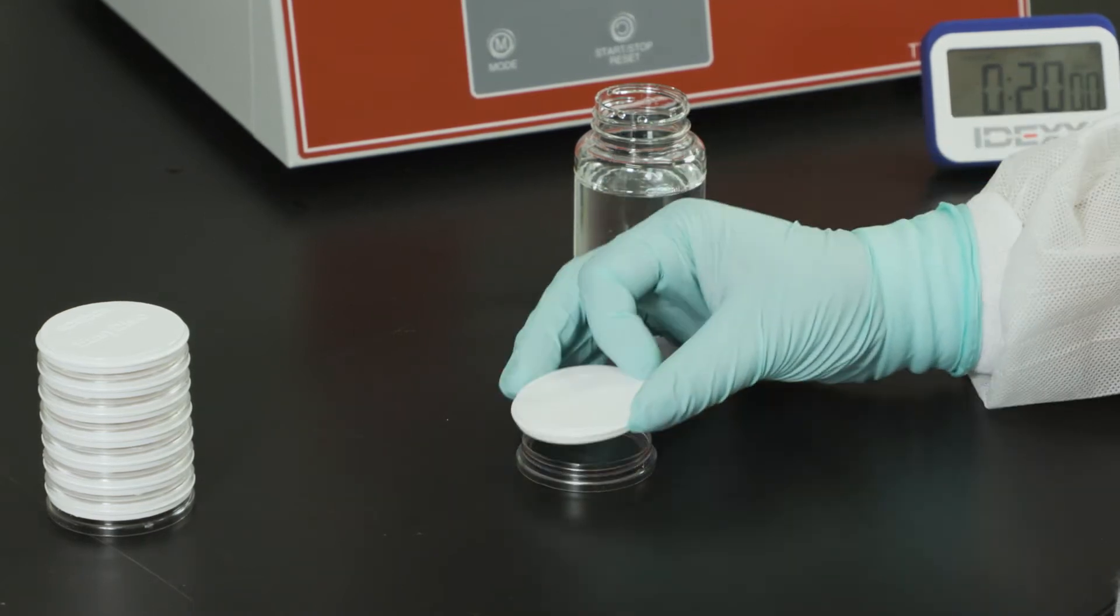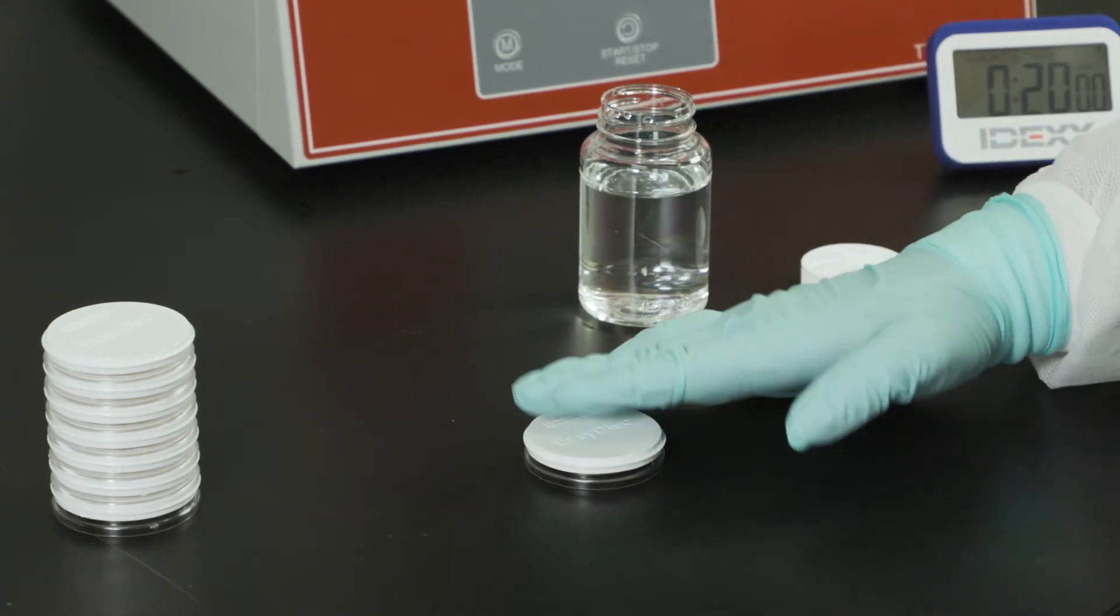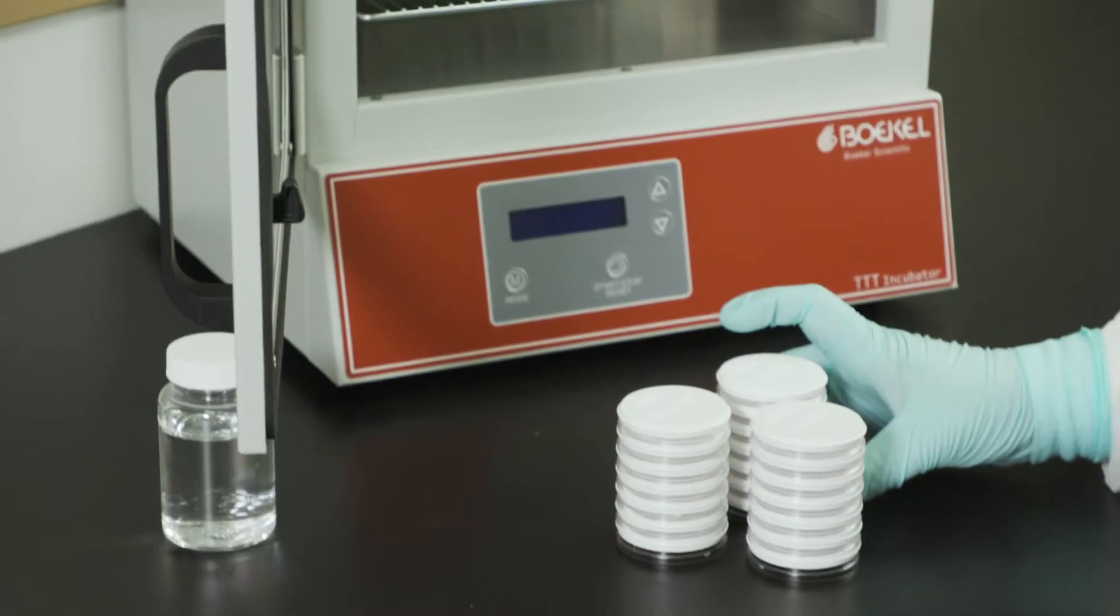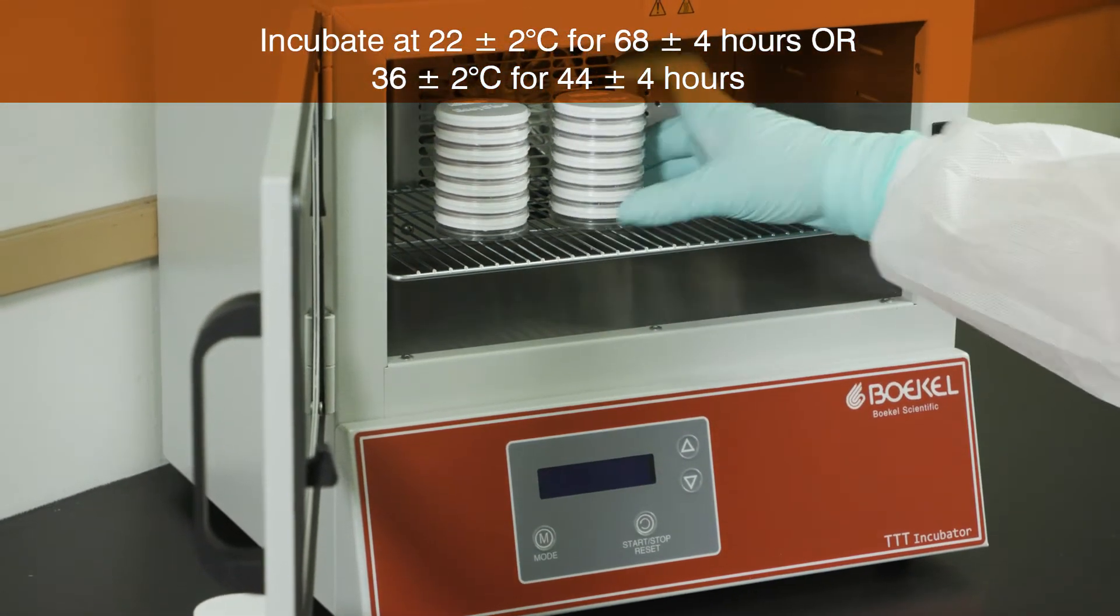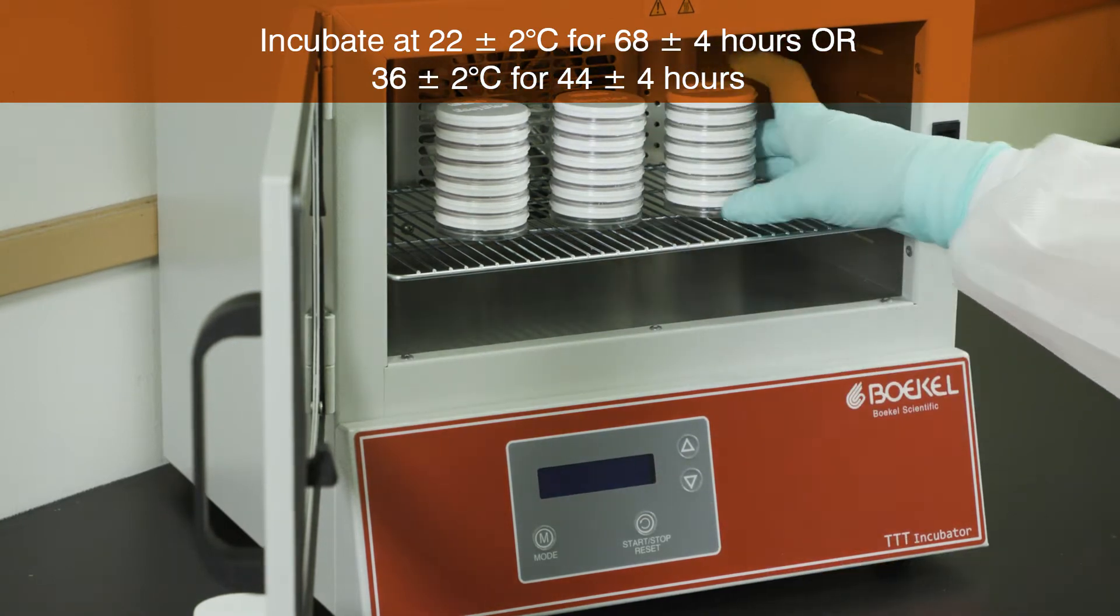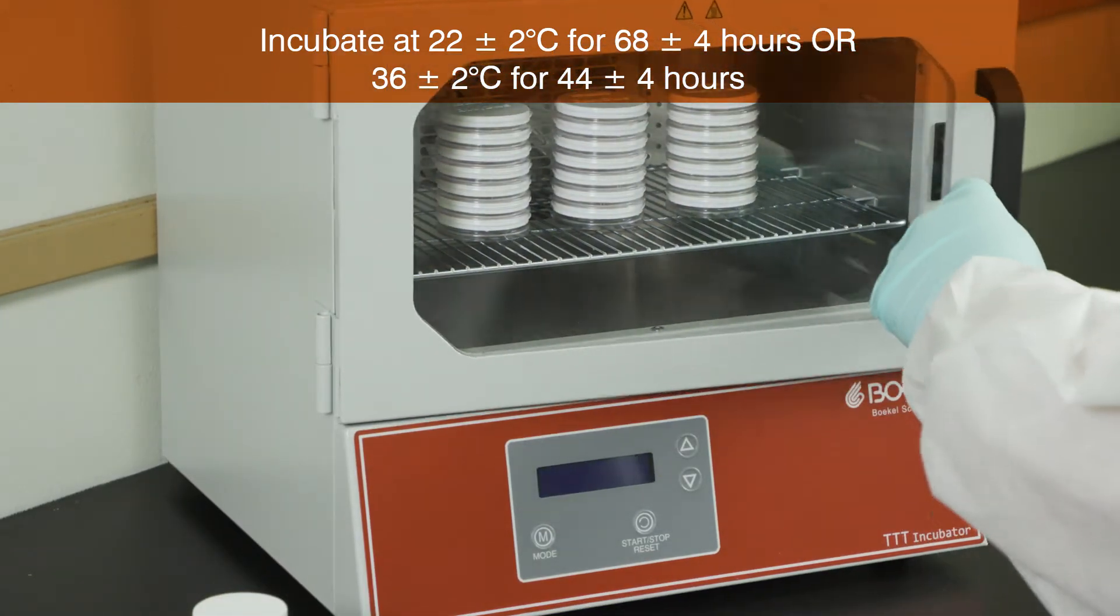Incubate undisturbed at room temperature for at least 20 minutes, allowing the media to set. Incubate the plate, white lid side up, at 22 degrees centigrade for 68 hours or 36 degrees centigrade for 44 hours.